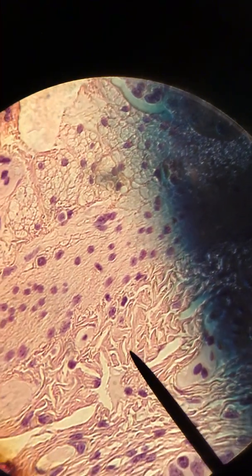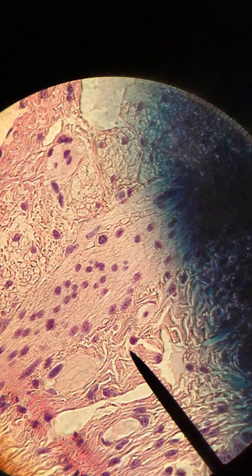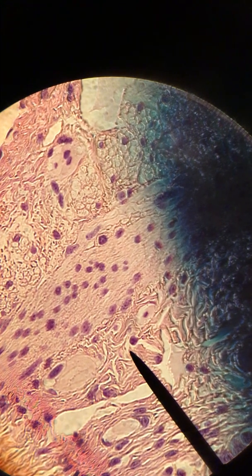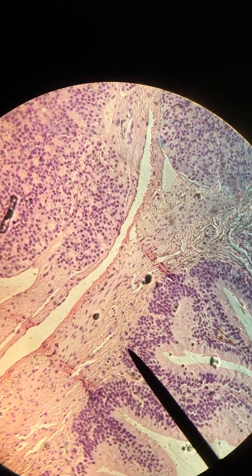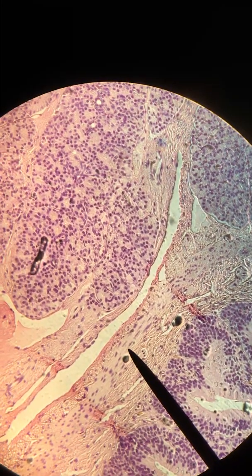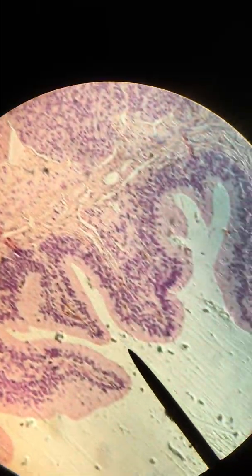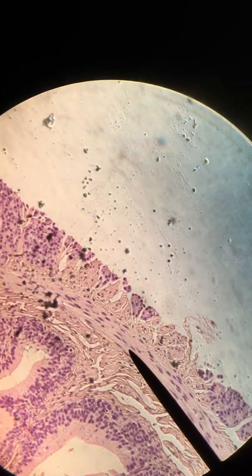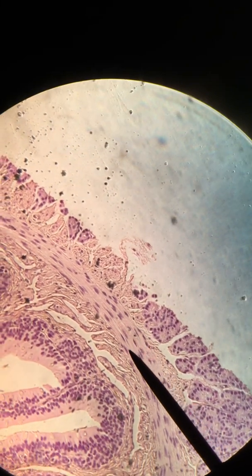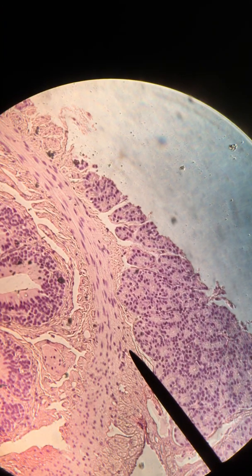The last thing we need to look for in this slide is smooth muscle, which will be surrounding the small intestine. I'm going to zoom out a little to show you — I think it'll be clearer at a distance first. This along here is smooth muscle, and it's going to be in a large amount of the area surrounding our small intestine. It goes all the way around. We can now increase magnification to look at it in more detail.